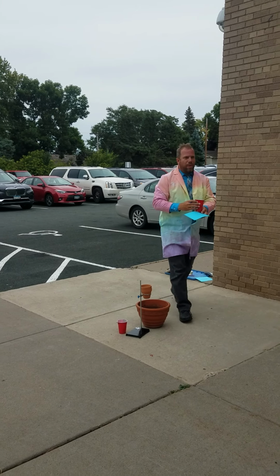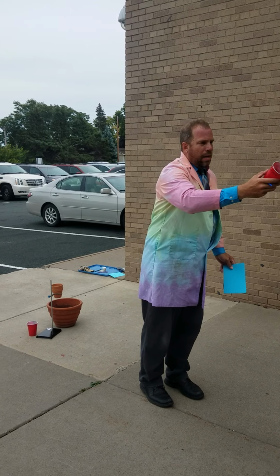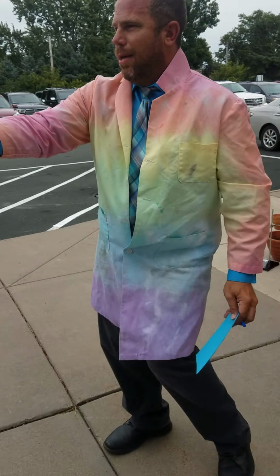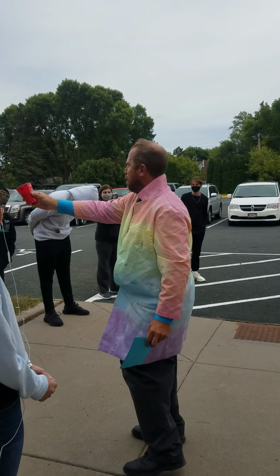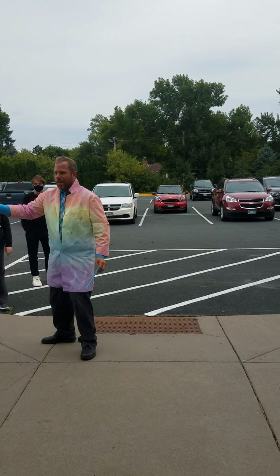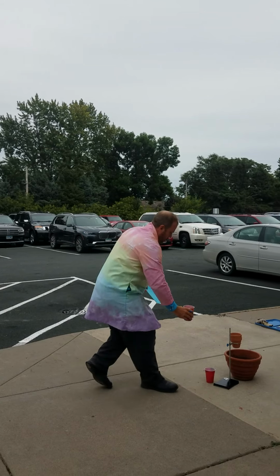Anyone can shout it out. What do you think this is? Feel free to shout it out online. What does it look like to you? What do you guys think? Okay, it's a red powder.